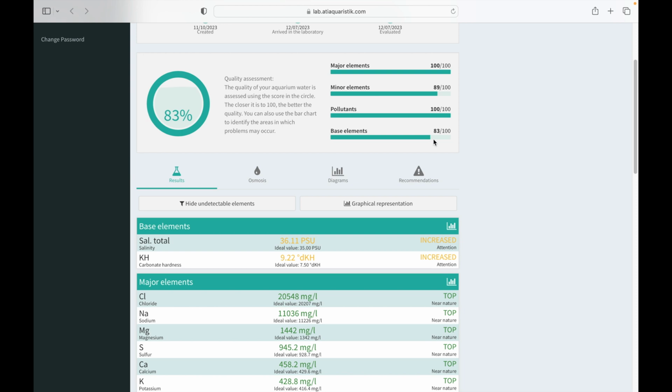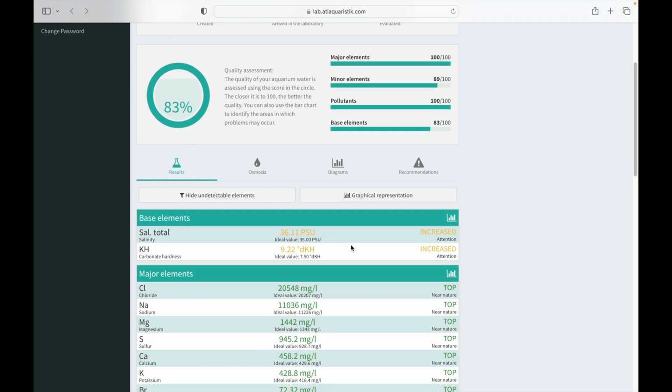The base elements. It's showing that we're a little out of whack here. Our salinity's crept up a little bit. My test at home here is showing salinity at 35.5, so within a half a point. Might be a little bit off. KH is showing that it's a little bit high. I like to keep my KH at 9, so to me this is an acceptable level.